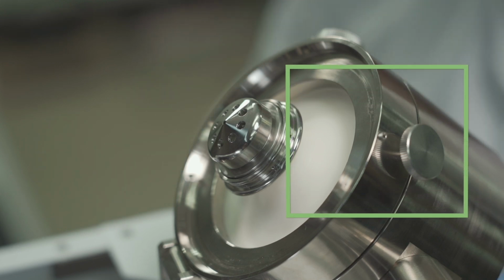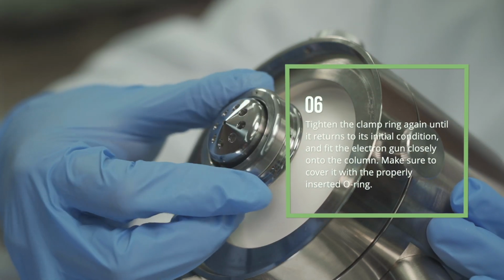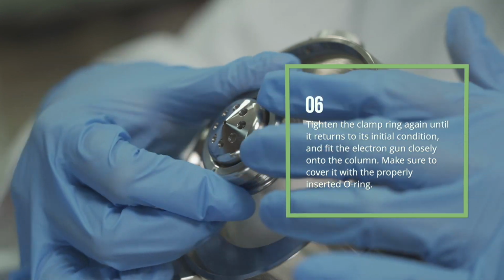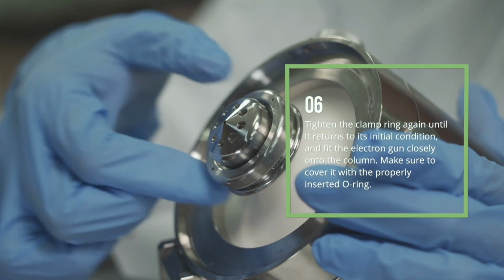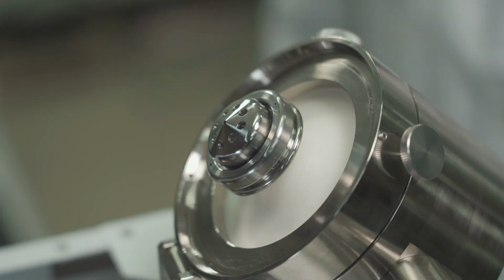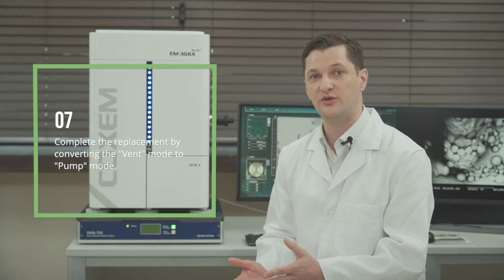6. Tighten the clamp ring again until it returns to its initial condition and fit the electron gun closely onto the column. Make sure to cover it with the properly inserted O-ring. 7. Complete the replacement by converting the vent mode to pump mode.